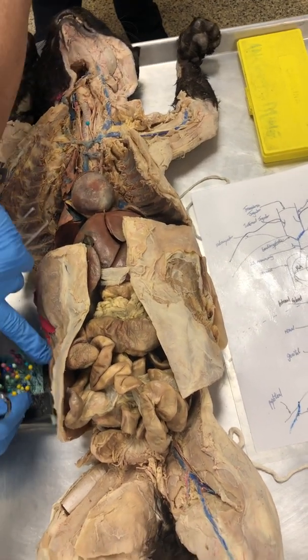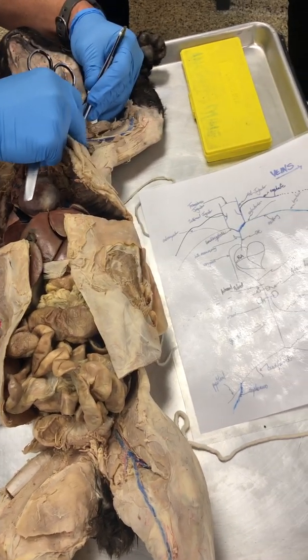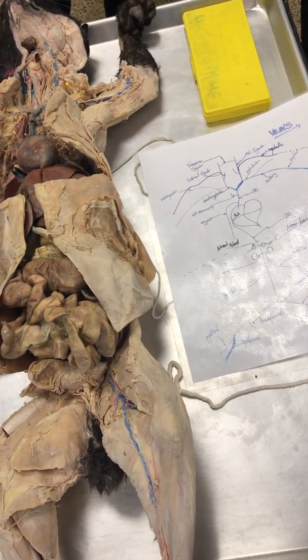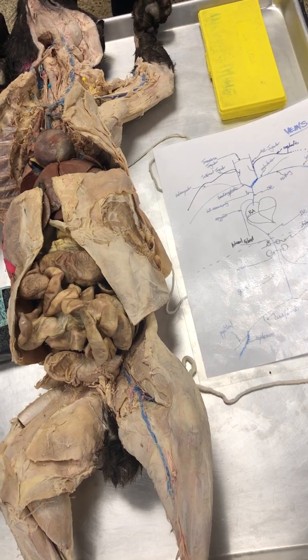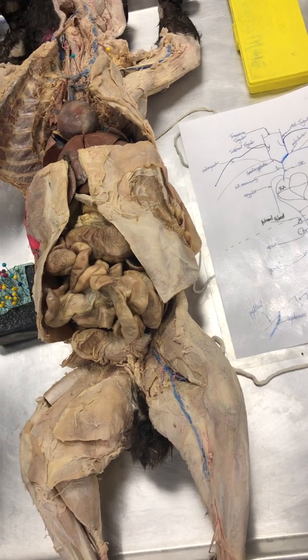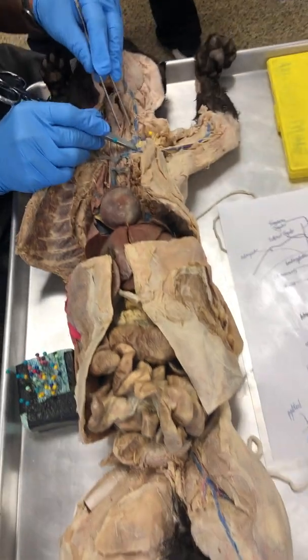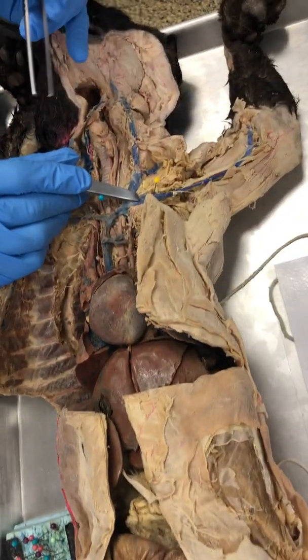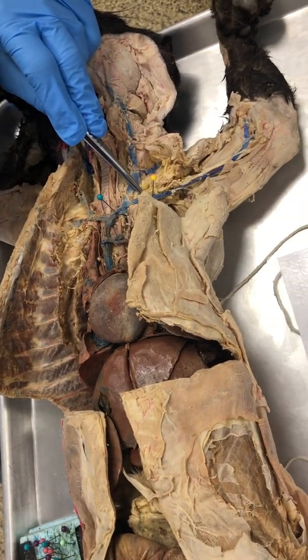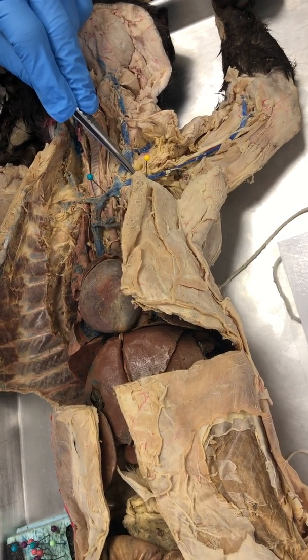All right, so now let's see what we have. When this blood vessel, ladies and gentlemen, is in the chest cavity, we cut that away, so it's in the body cavity under the clavicle. Now, what is the root of the word for under? Sub. So we can call it the subclavicular, or the Latin word subclavian. So there's subclavian in the chest cavity under the clavicle. It's the same one blood vessel though, with different names.